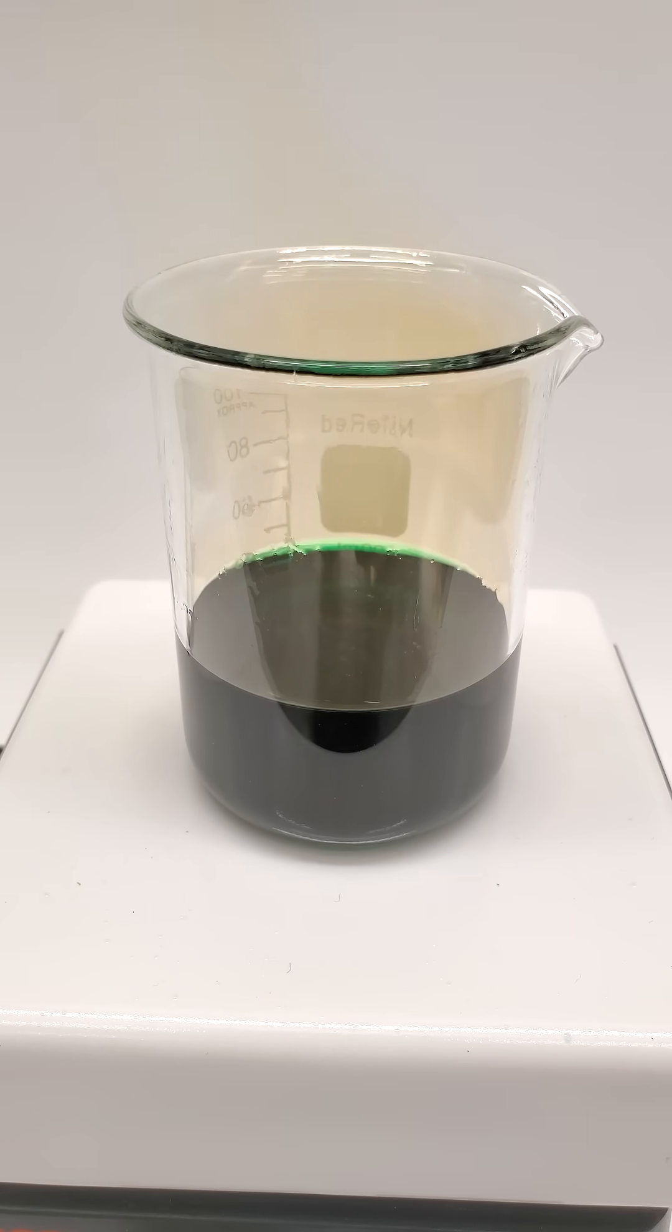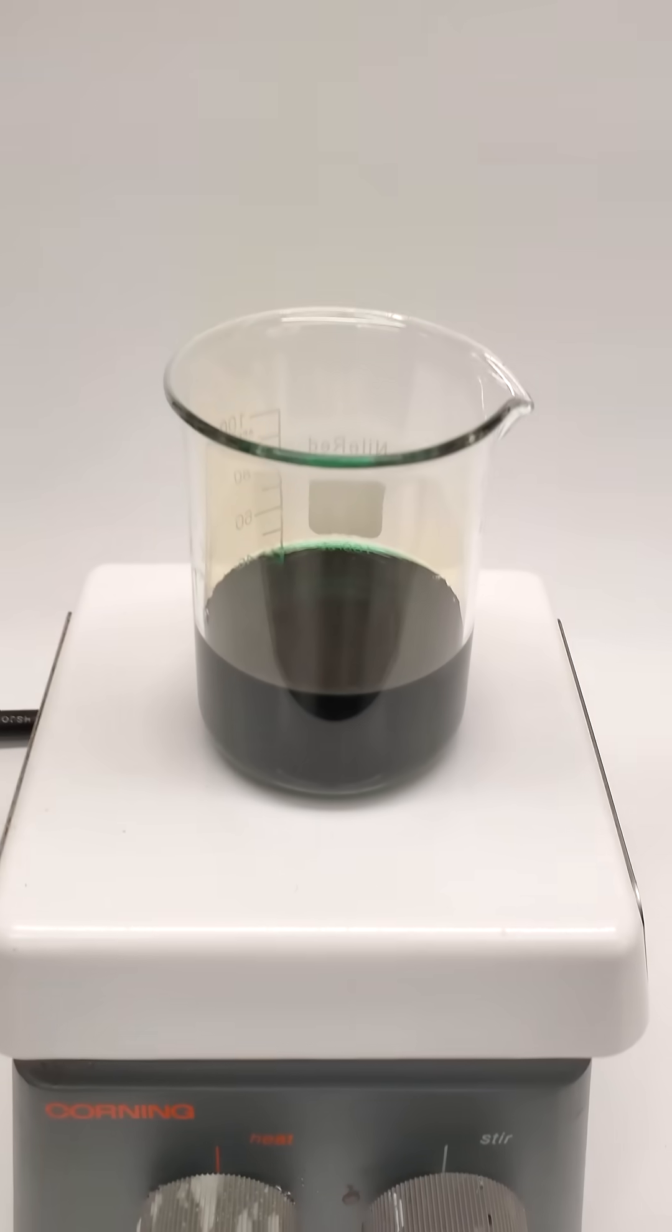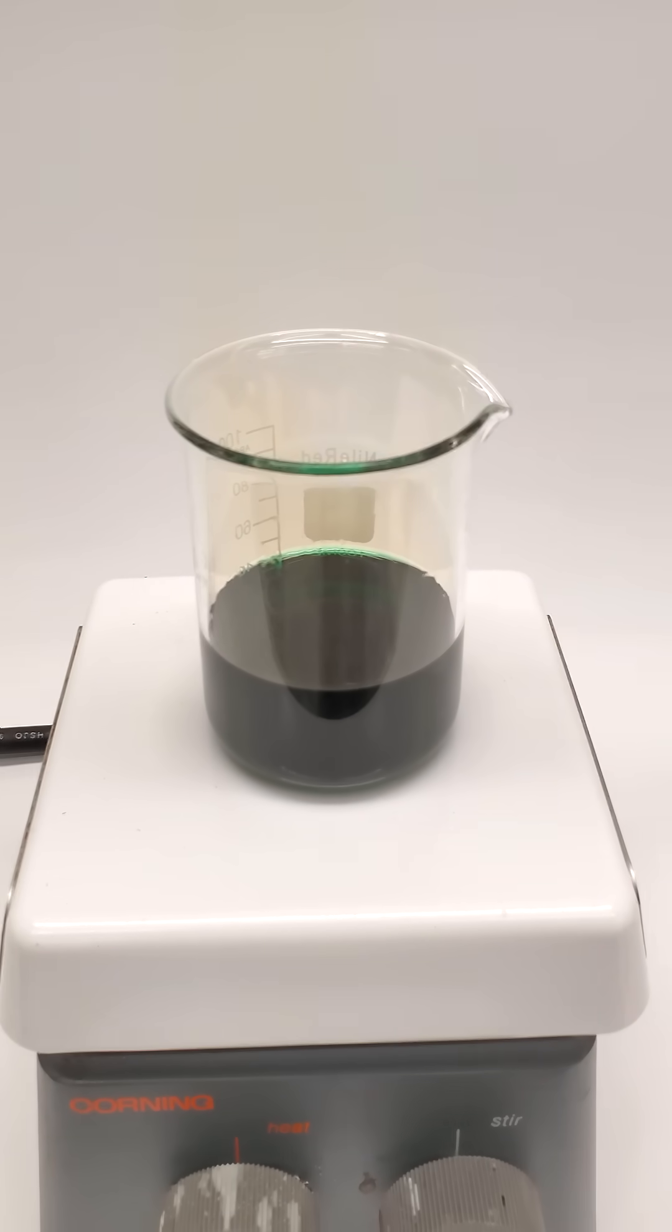It took about 10 minutes, but the penny's completely gone now. The color's also green because of the copper nitrate that formed.